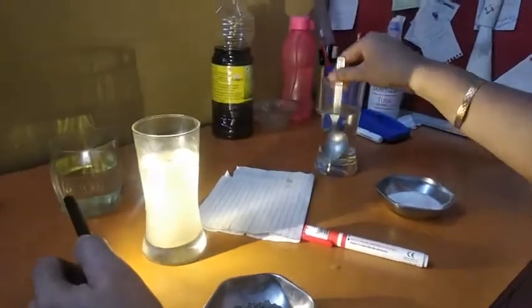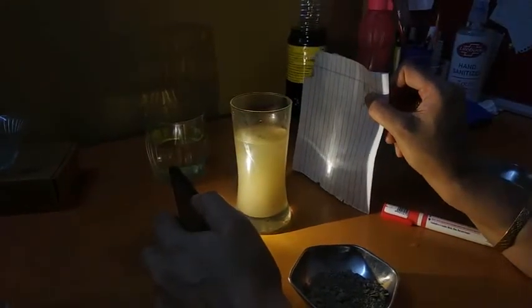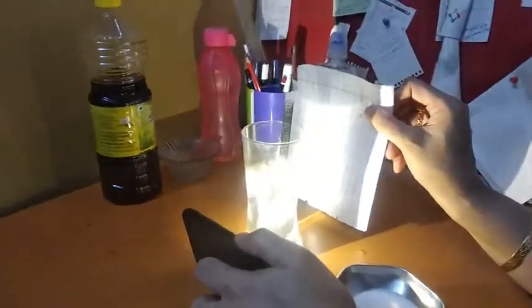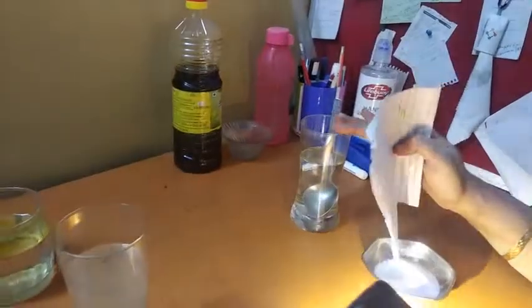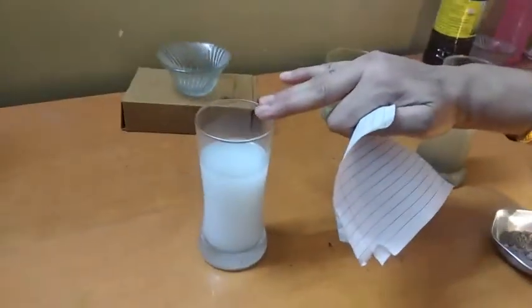Okay. Now if I mix it, then still chances are there it will show some amount of Tyndall effect. But if it is settled, then it is not showing Tyndall effect. Now this is true solution. If I allow the light, now look at the paper. Light is passed through it. So this is not showing Tyndall effect. Light passed through, no scattering of light through this solution. Okay. So this is the true solution, suspension and colloid.